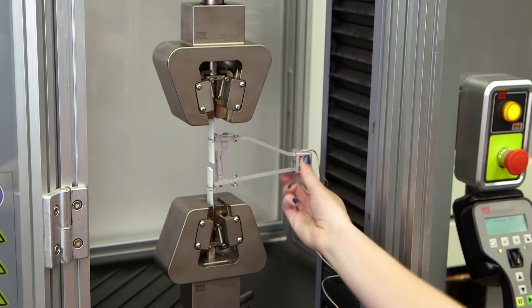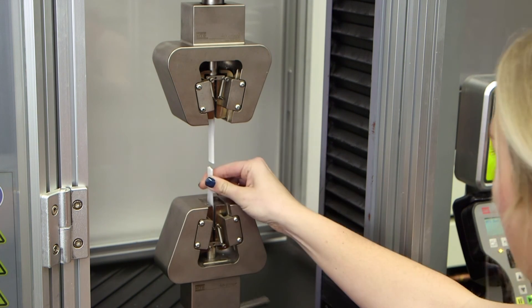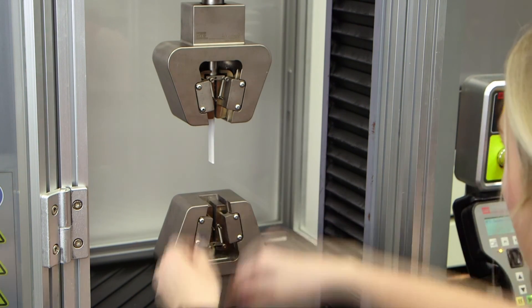After the test is complete, we can remove the specimen and the extensometer from the test space and return the load frame to its zero position.